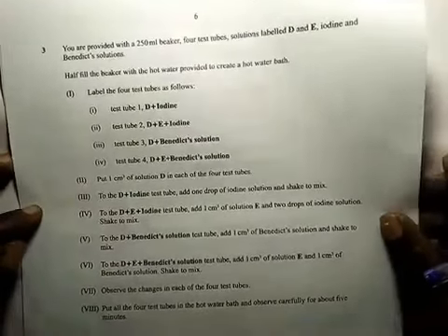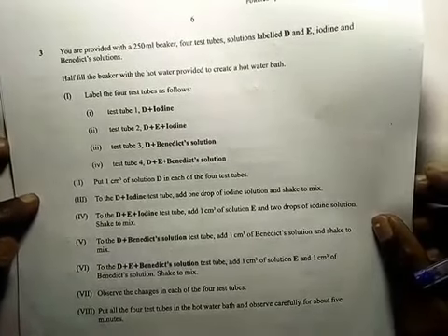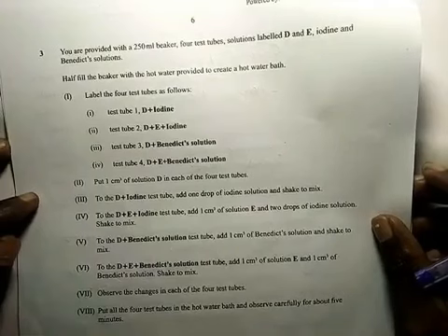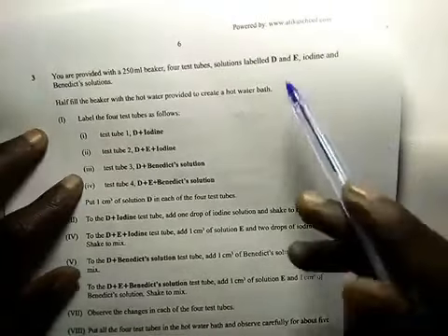Question number 3, our last question, is on food test. You are provided with a 250 beaker, 4 test tubes, solutions labeled D and E, iodine and Benedict solution. First of all, you should be able to know what the reagents you are provided are used to test for.